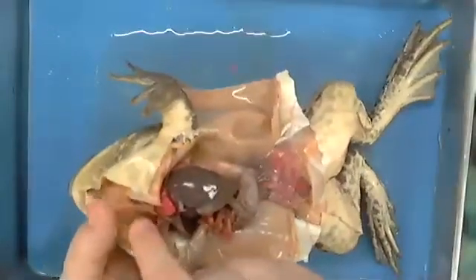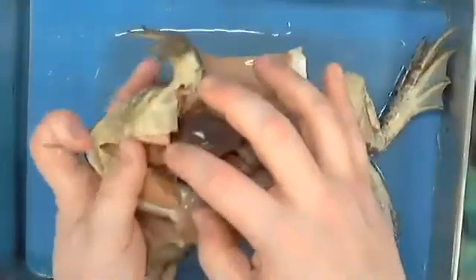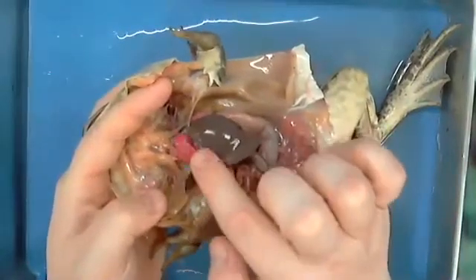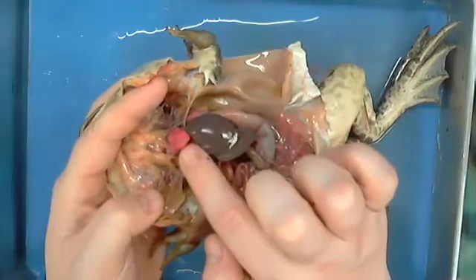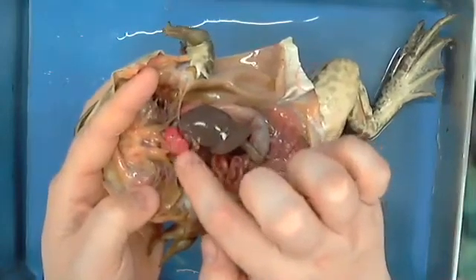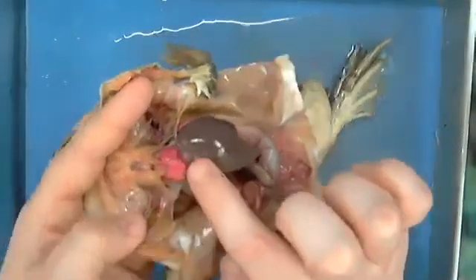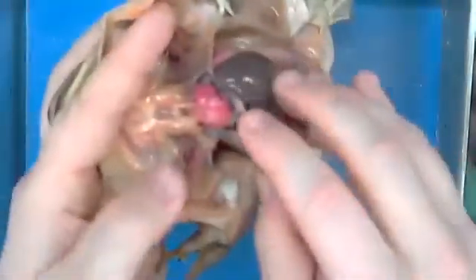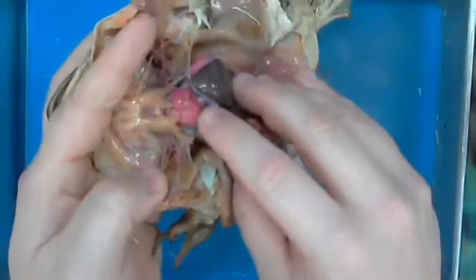All right, heart, very simple and straightforward. Everybody can see it. I'm going to get this out of the way. Here's our heart. He happens to have a multi-chambered heart. Technically, in his case, he has one ventricle at the bottom. We'll see if we can see it that way. Right here, this very bottom that you see.